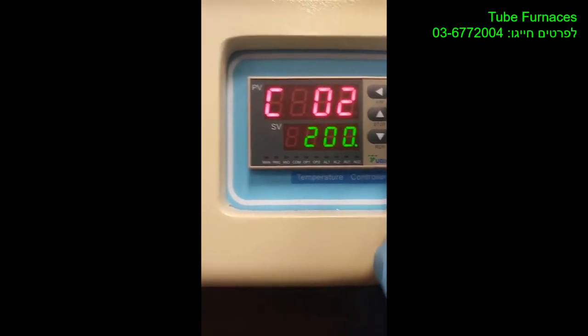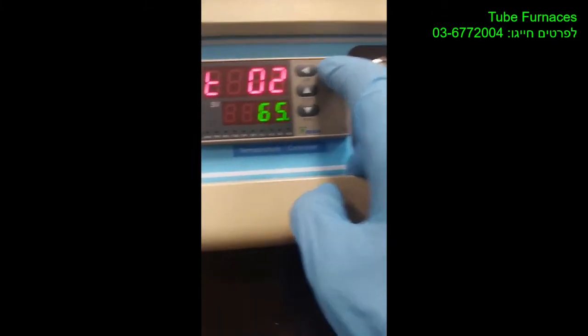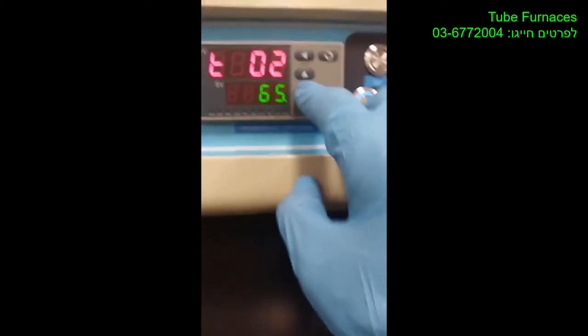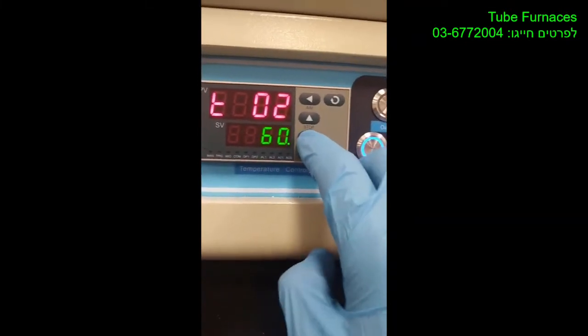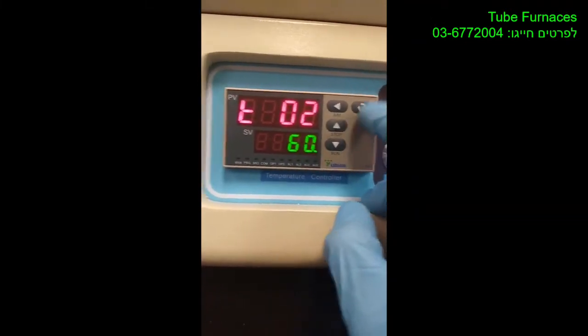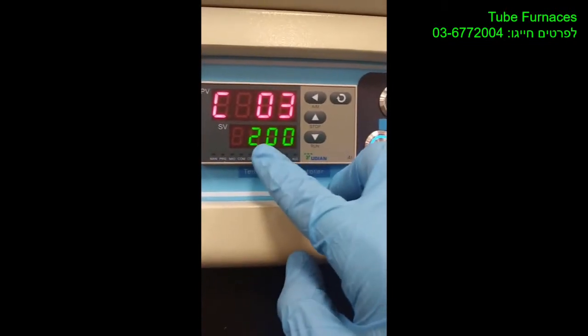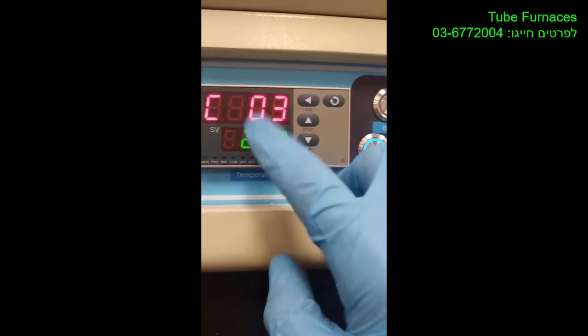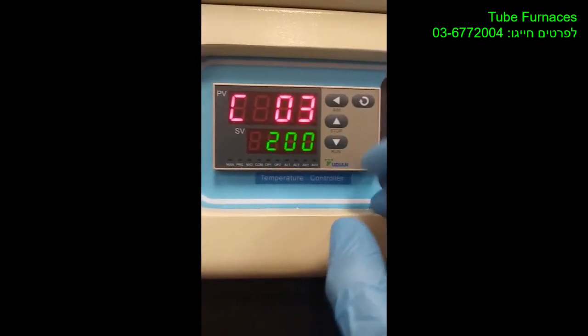Then the temperature that you want, let's say 200, and then let's say next step you want that furnace to hold on that temperature for a certain time. Let's say you want it to stay for an hour, so 60 minutes. Then the next temperature will be the same, so the furnace will know that I want to stay on this temperature for the last 60 minutes I put.